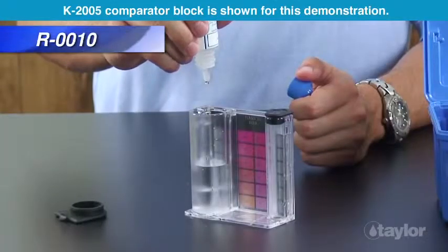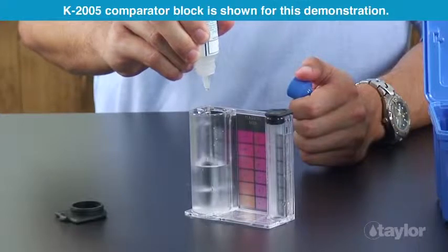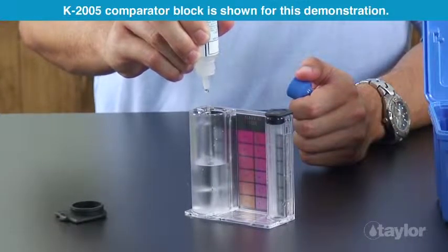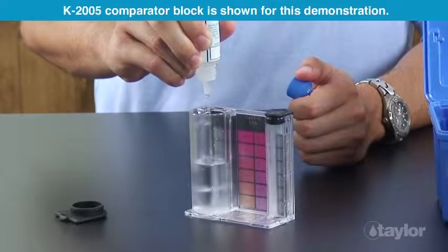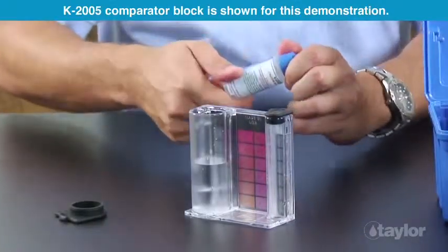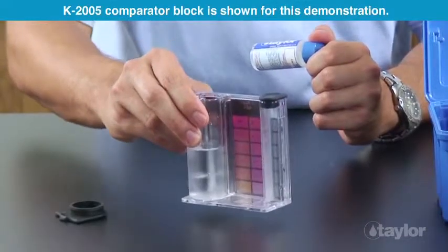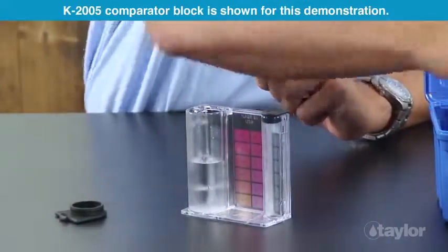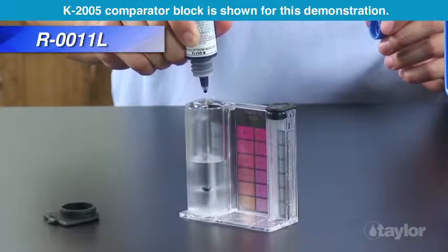Add 20 drops of Reagent 10. Swirl to mix. Add 5 drops of Reagent 11L.